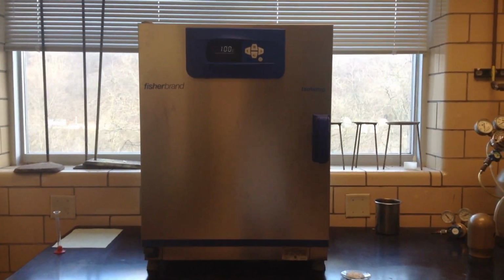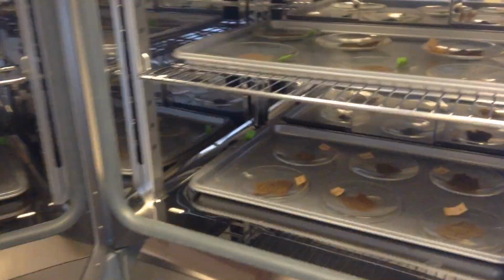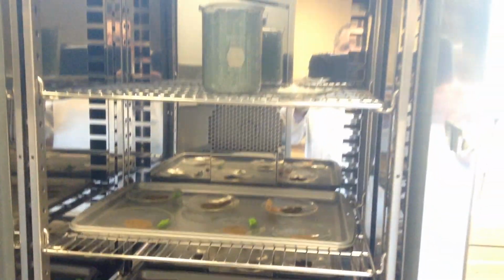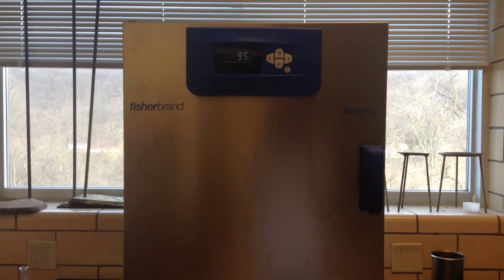So we're in the back of the lab. Notice we have an oven. It's set to about 100 degrees. We also have our maleic acid. So open this up. Notice there are several things in here, so we'll make sure we set ours on the top shelf there. So there's our maleic acid, and we'll let that go. And we'll start the heating, and then we'll probably let that go for about a half an hour or so. I'll give you the time in a second.